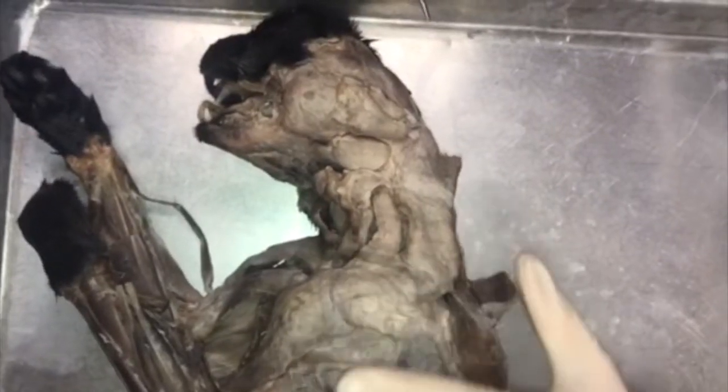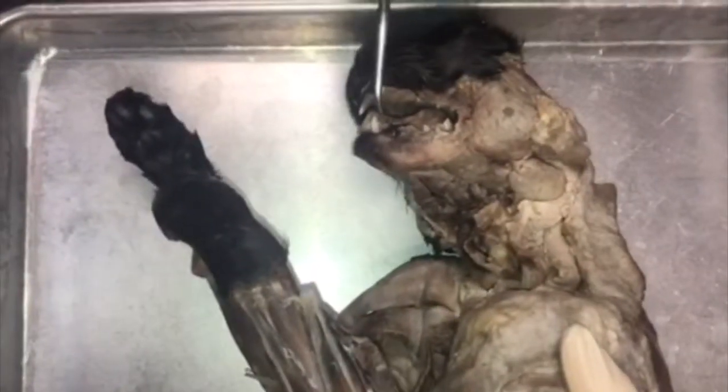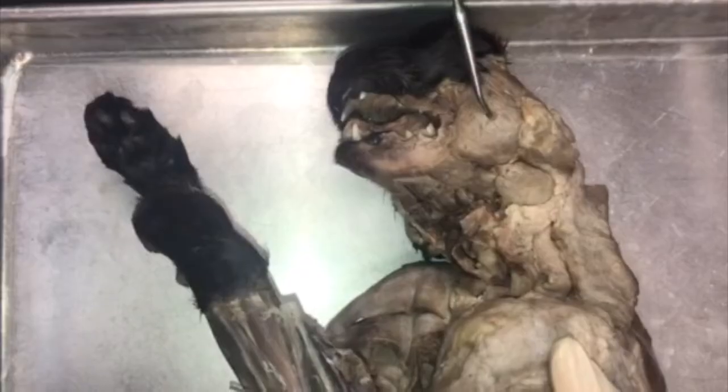So we're going to review the head and ventral neck muscle IDs of the cat. Up here, this muscle on the top of the head is going to be your temporalis. If we move forward, more towards the mouth, this round muscle here is going to be your masseter.